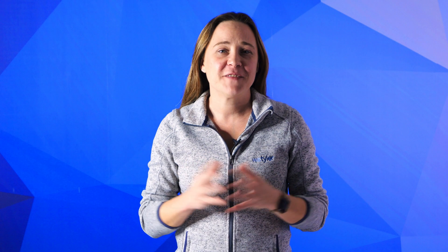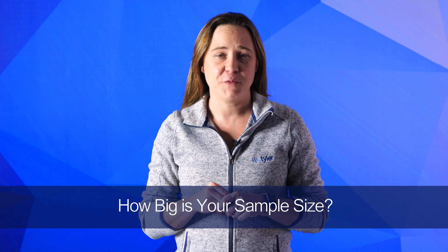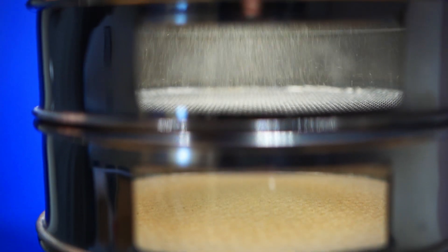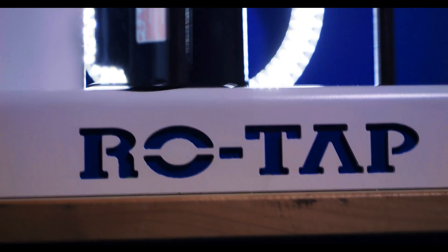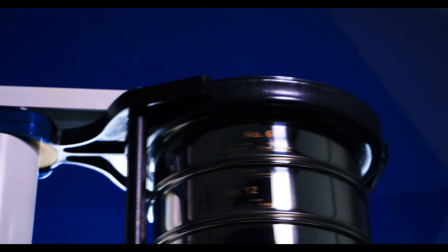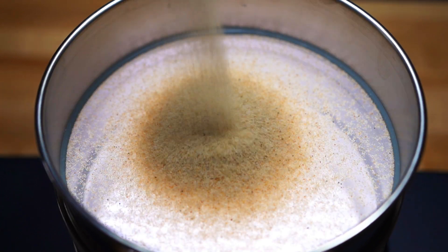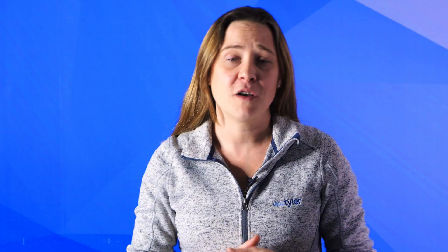The most obvious factor is the overall size of the sample being run. The more material that's put into a sieve at once, the longer it will take the ROTAP to separate the particles and allow them to fall into their respective sieves. Also, if you overload a sieve with a large sample of particles, it'll probably cause that sample to either get bad results or cause blinding in your sieves.